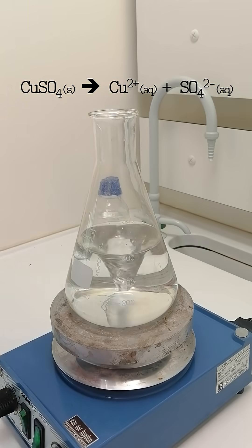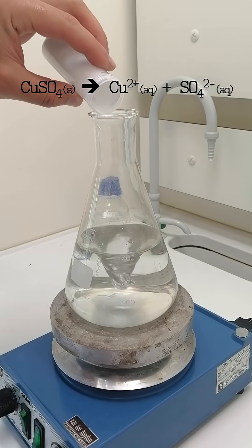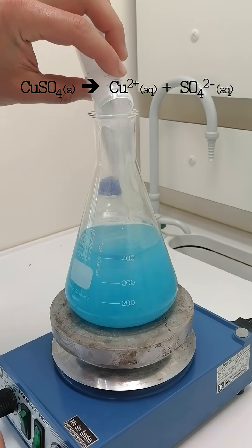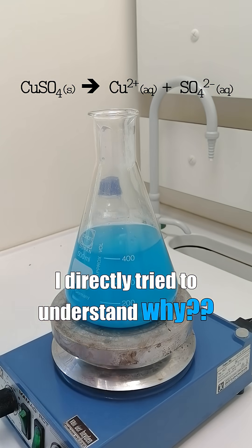The first step is to dissolve copper sulfate into water. I was immediately surprised by the intense blue color of the solution, so I tried to understand why.